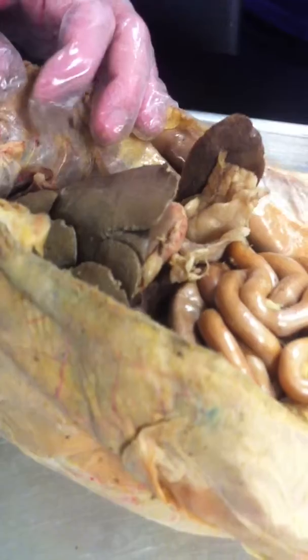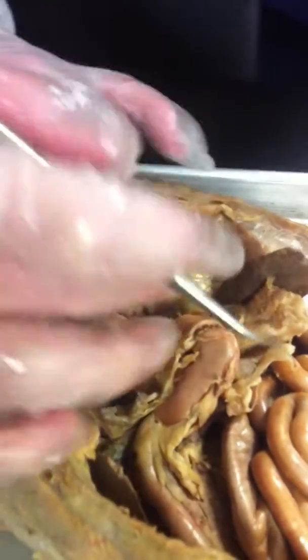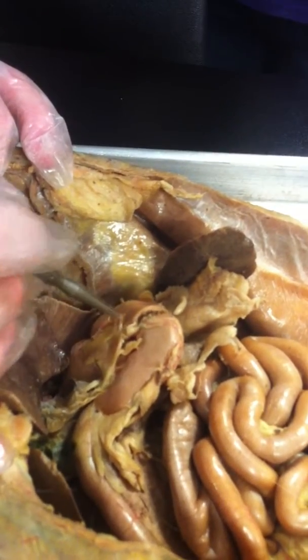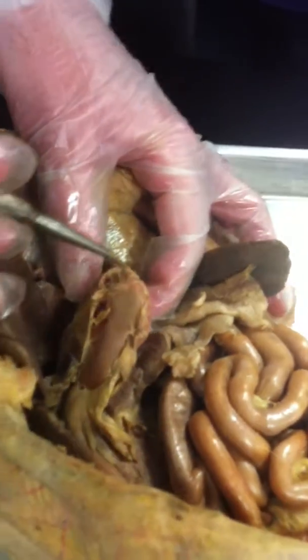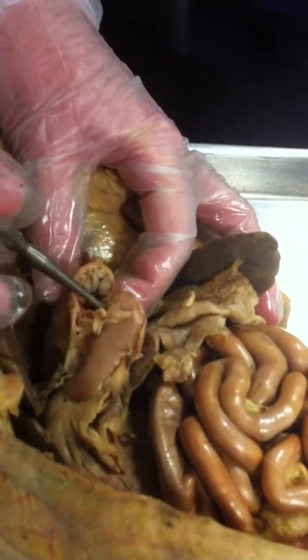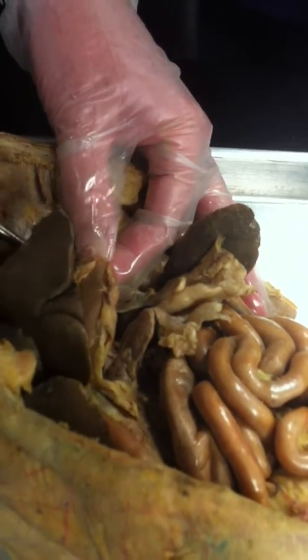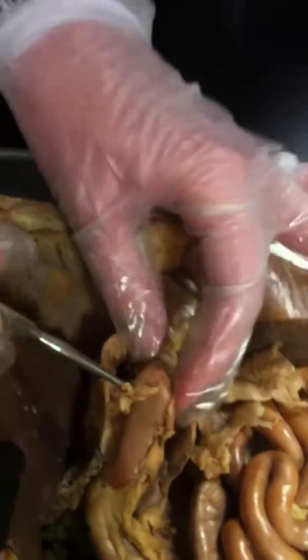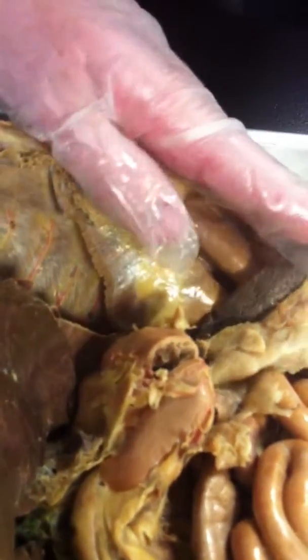Next, if you cut open the stomach, we should probably find parts of the stomach. The stomach has a region here that's flat. That's called the fundus. Most of it's the body. The tail part's called the pyloric region. If you cut open a stomach, you'll see that it's folded. Now, Miss Ramey cuts hers different than mine. I don't usually cut stomachs this way. But you see how there are folds in the stomach. Those are called the rugae of the stomach.